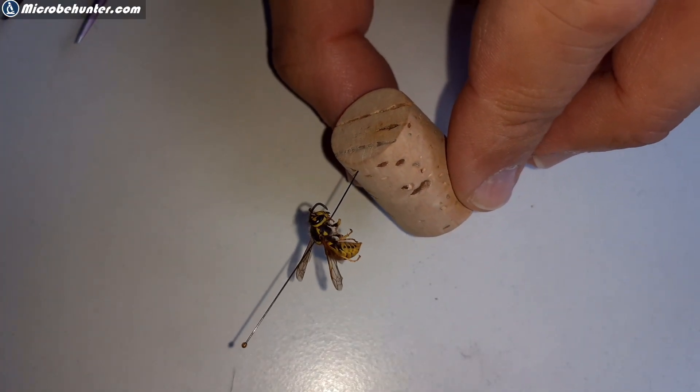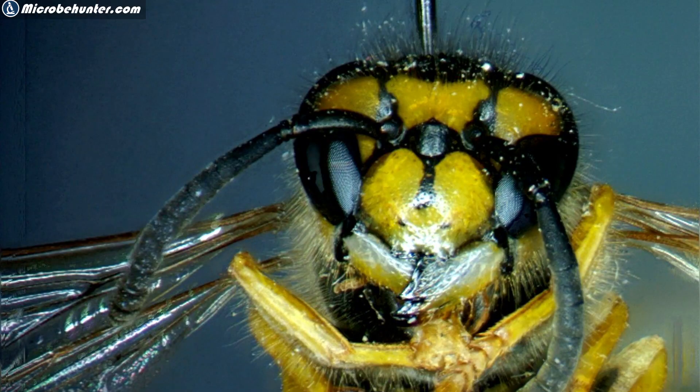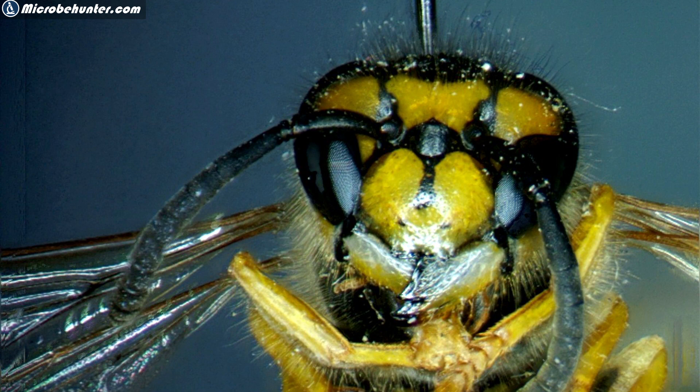For example, here is a wasp, and I put it under my stereo microscope to take pictures because these are insects living directly in my area and I just want to look at them under the microscope. Why not find insects that are typical for your area and put them under the microscope, or the native plants that you have growing in your region? Maybe make a pollen collection. You have the opportunity to define amateur microscopy in a totally different way than I have.